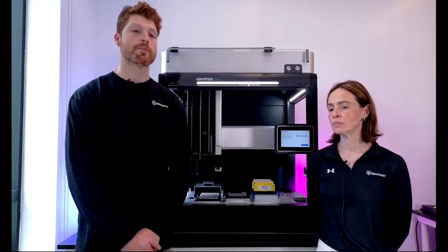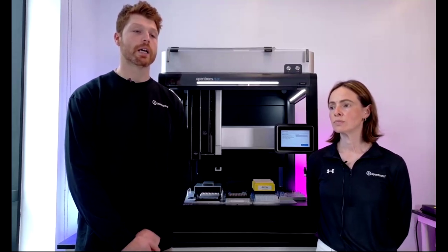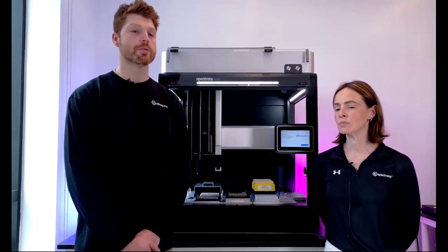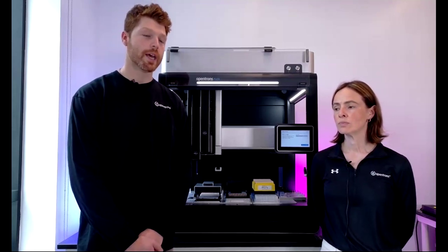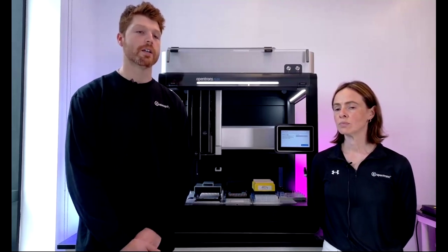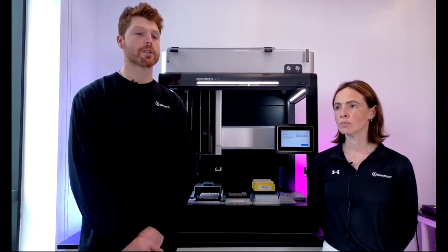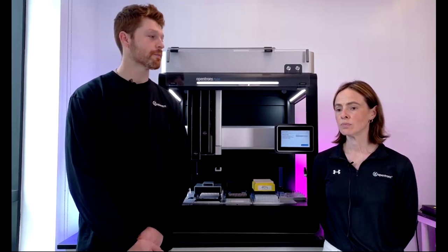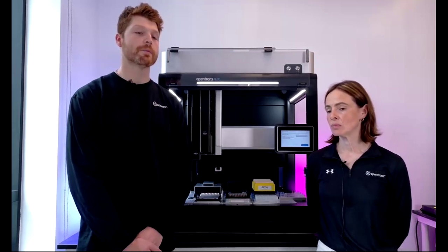Off of that, doing some optimization work to configure the pipette to consistently go to the right height to aspirate off of that pellet is the best mechanism for doing that. Whether you want to do it with a single 8 or 96 is also a variable question of how precise you want to be, since the 8 and 96 are not going to move to variable Z heights individually. But we should be able to do that fairly effectively as long as it's optimized for that.